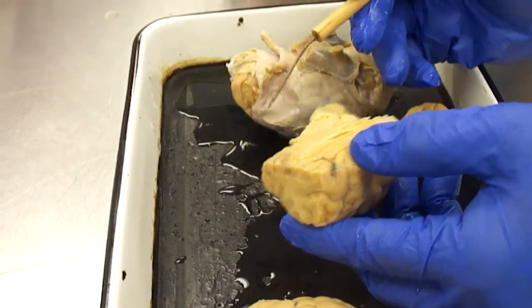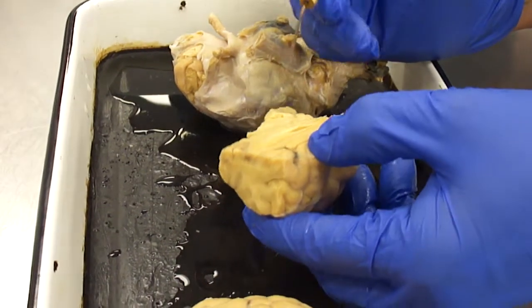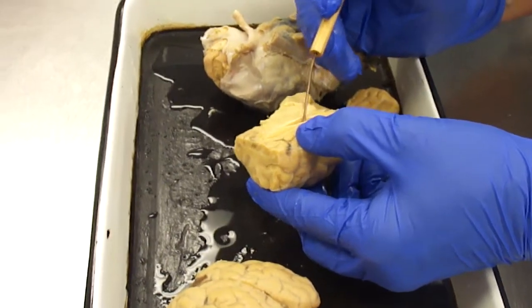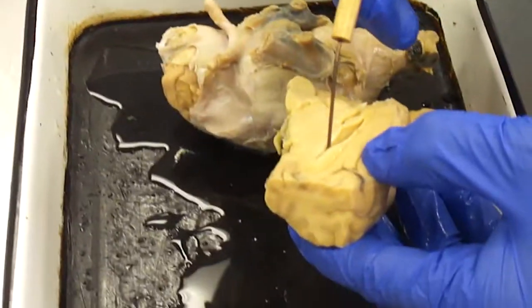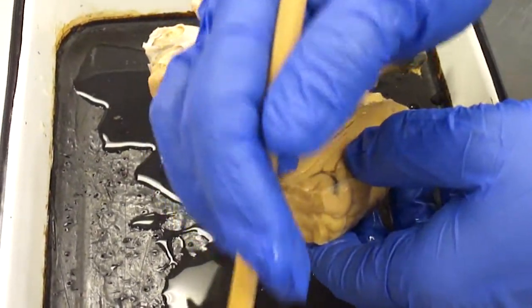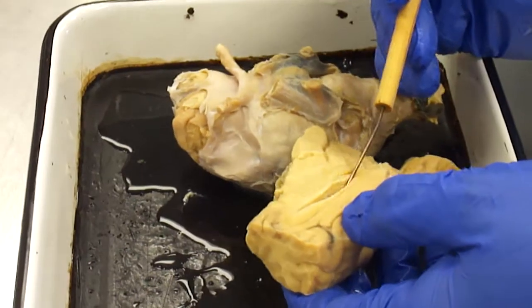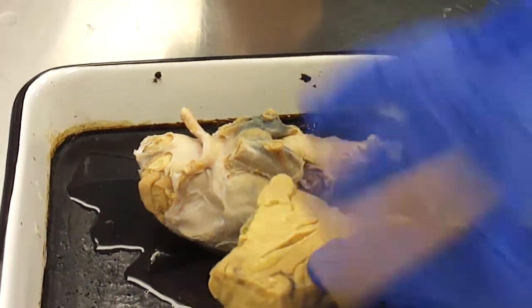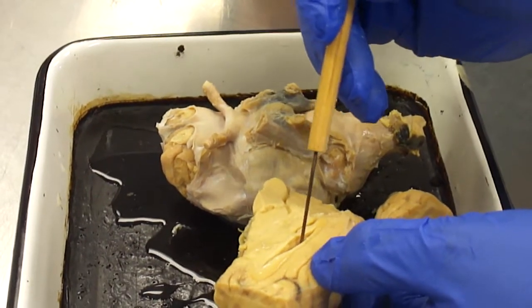There are four ventricles in the brain. A ventricle basically is just a space. These ventricles are filled with cerebrospinal fluid, CSF. And there are two lateral ventricles, and they're the biggest. The lateral ventricles are the spaces in the cerebral hemispheres. So there's one in the right and one in the left. It doesn't matter which is which. There's two of them. One's right and one's left. So this is a lateral ventricle.